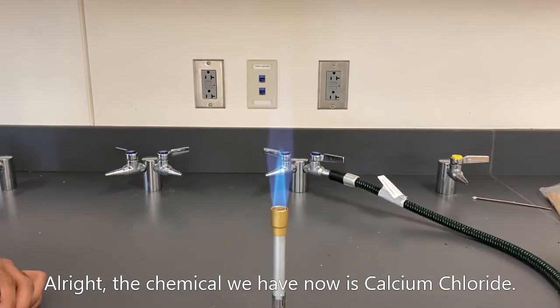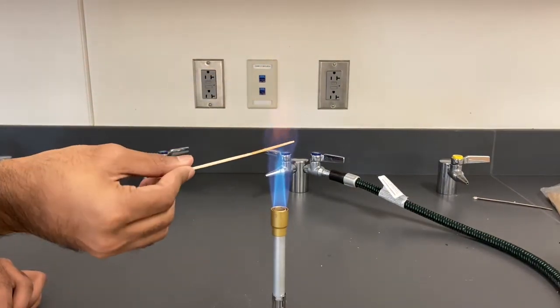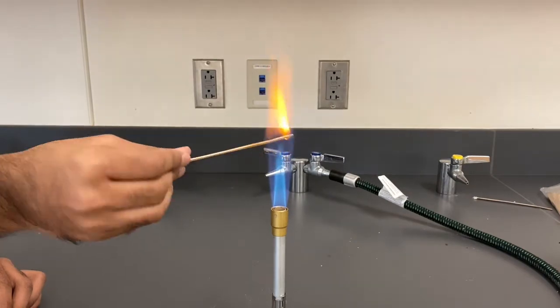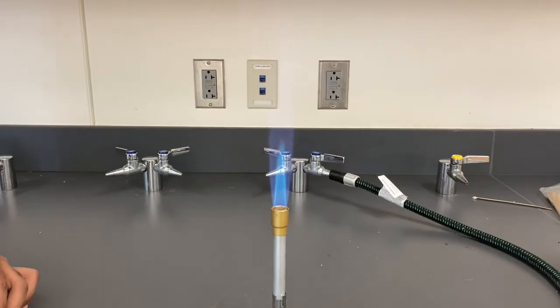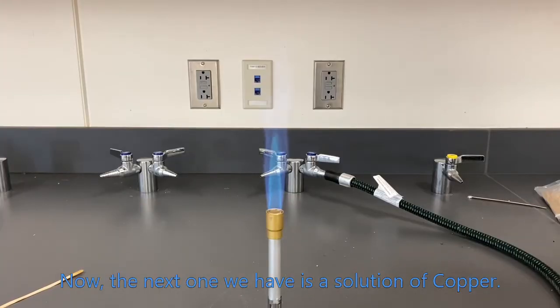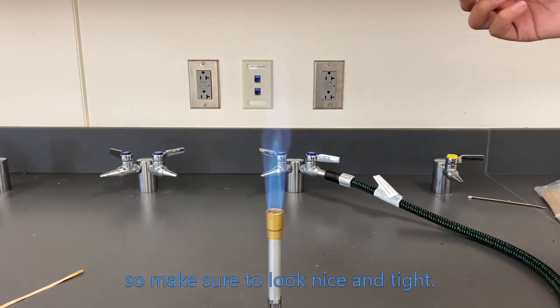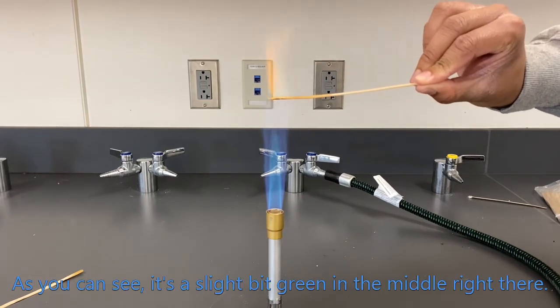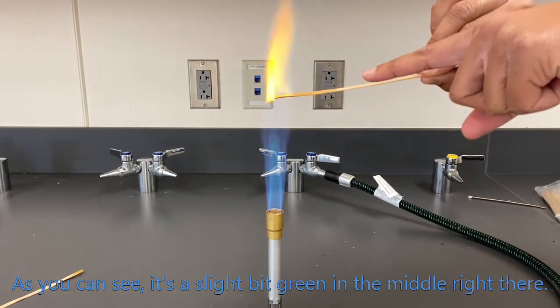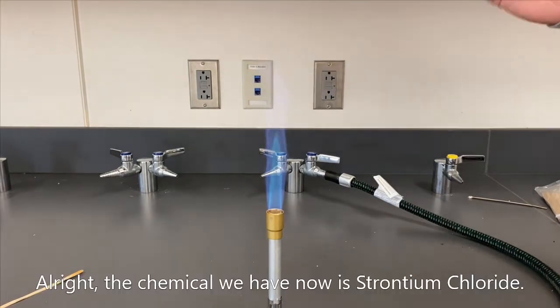Alright, the chemical we have now is calcium chloride. Let's see. As you guys can see, this one's a nice bright orange. Now the next one we have is a solution of copper. This one's a little harder to see the colors, so make sure to look nice and tight. As you can see, it's a slight bit green in the middle right there. It's a little hard to see, but hopefully you caught it.